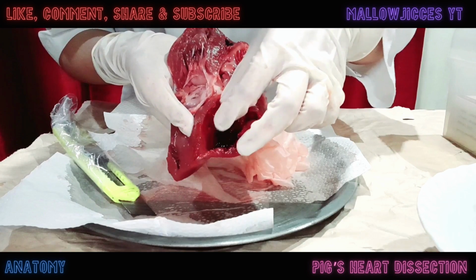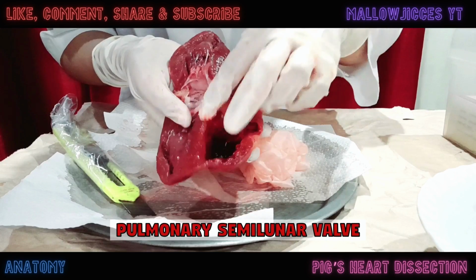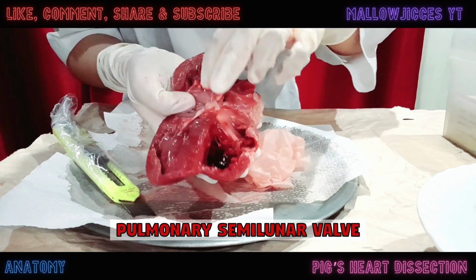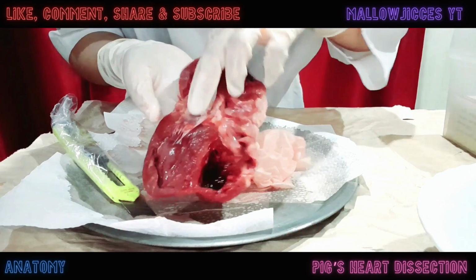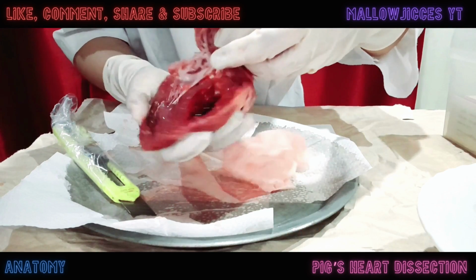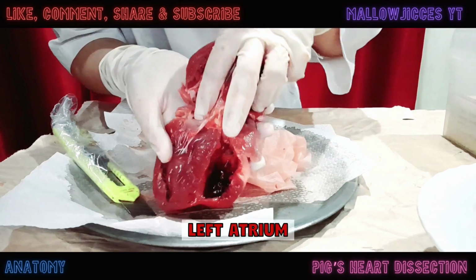From this right ventricle here, blood will enter into this pulmonary valve, which will enter the pulmonary trunk to the pulmonary artery into the lungs to be oxygenated. After the blood is oxygenated, blood enters into the pulmonary vein into this left atrium here.